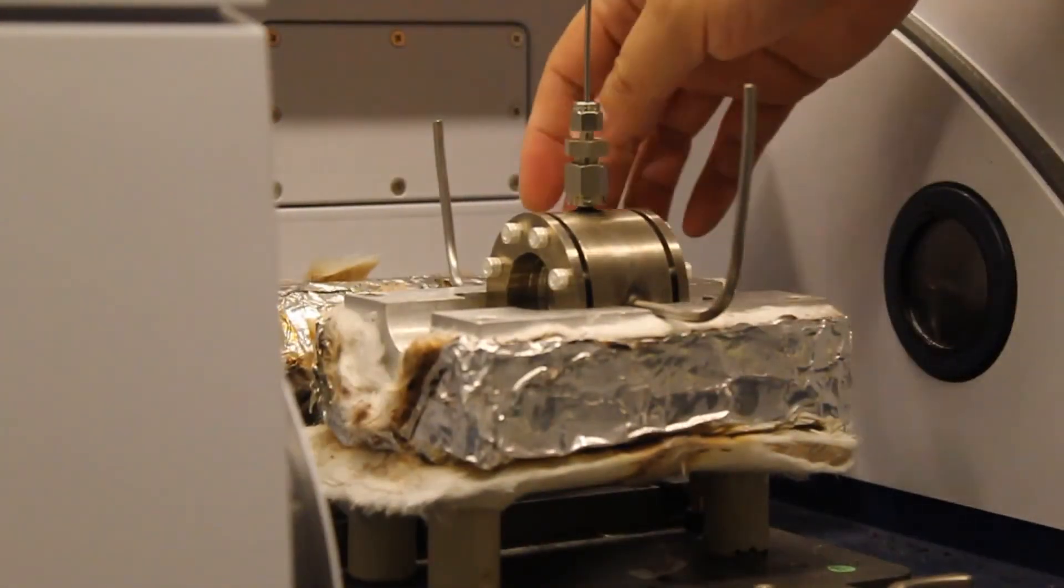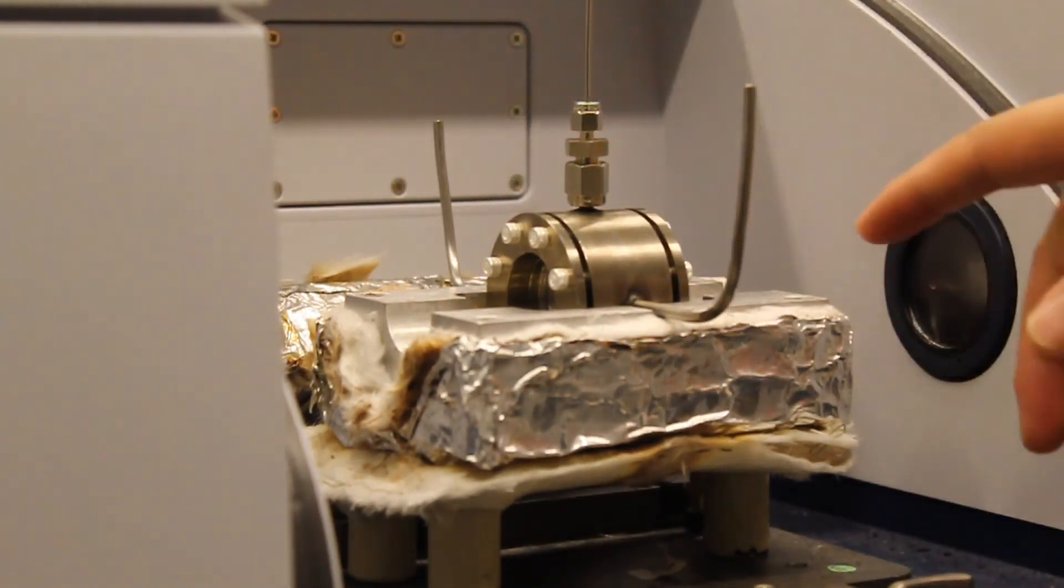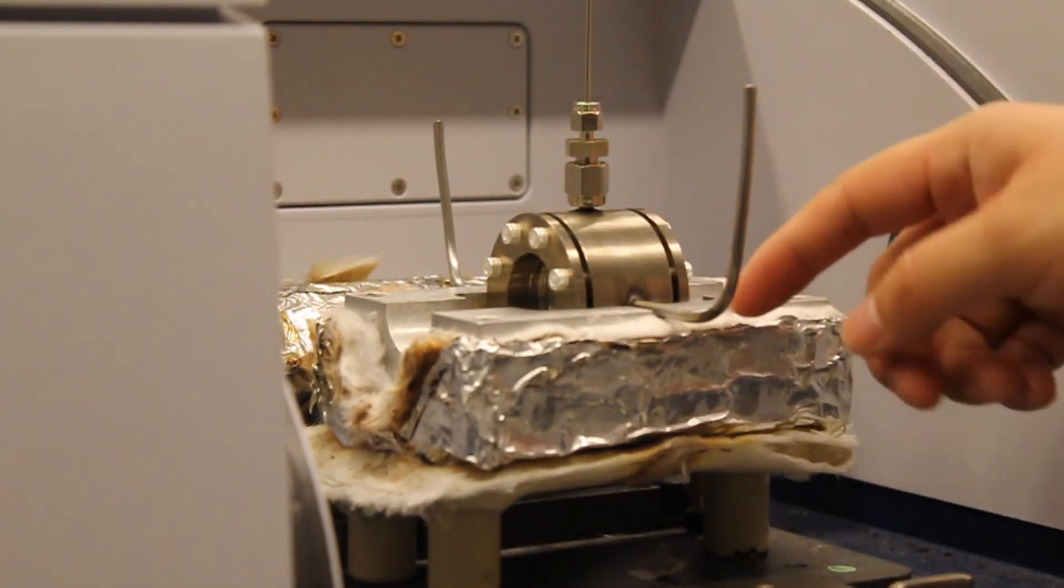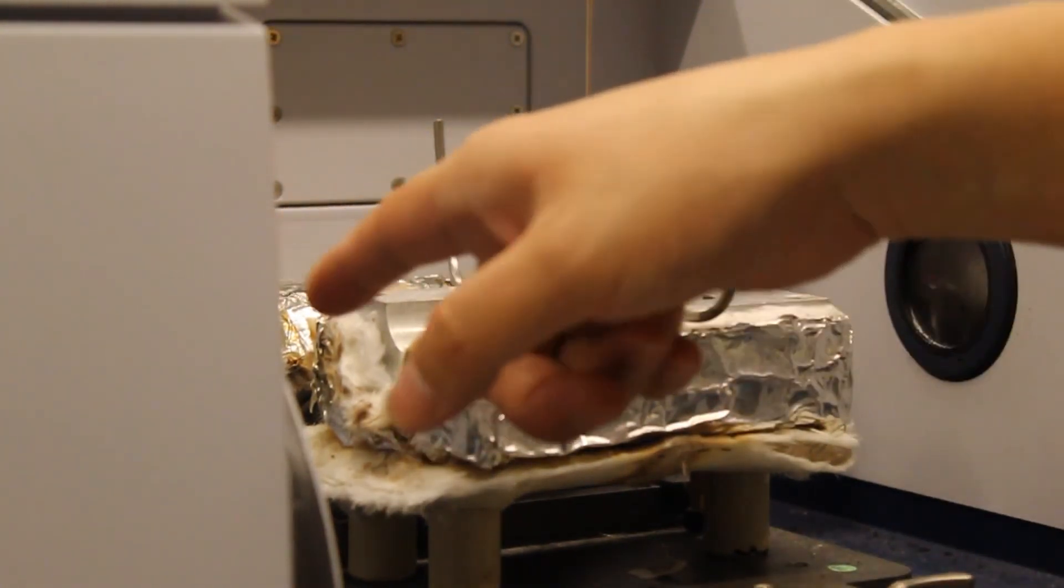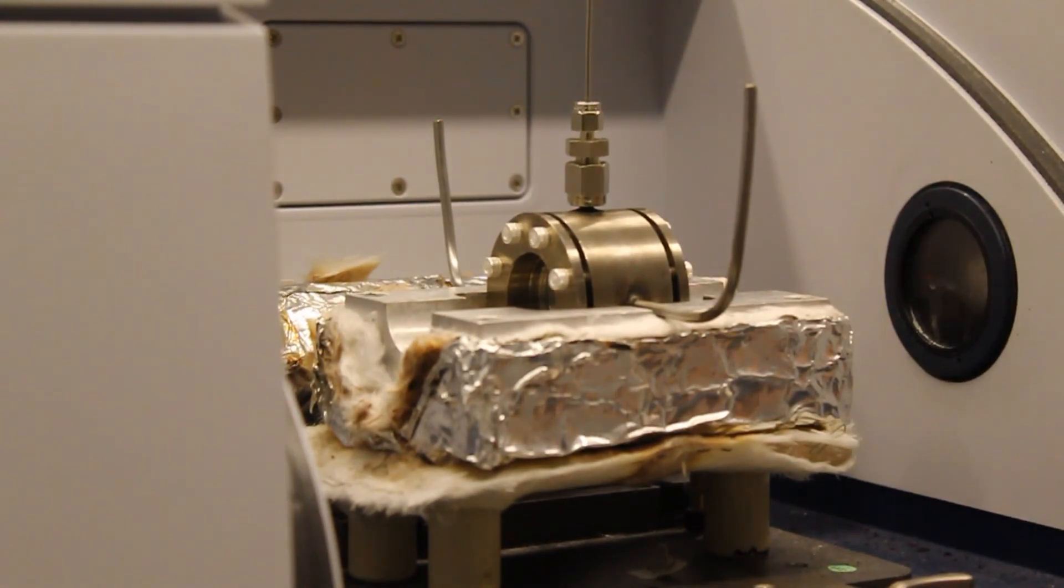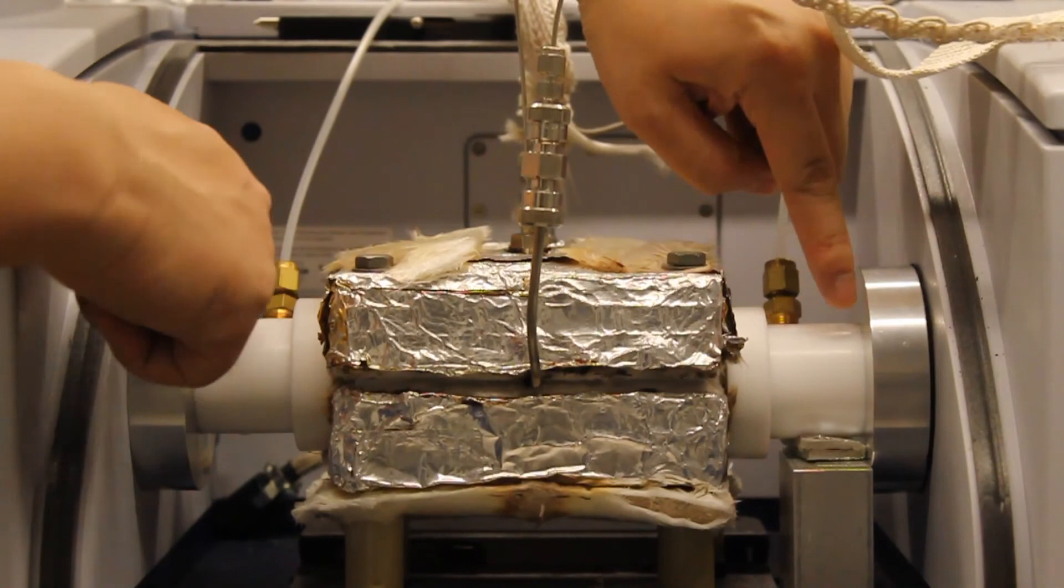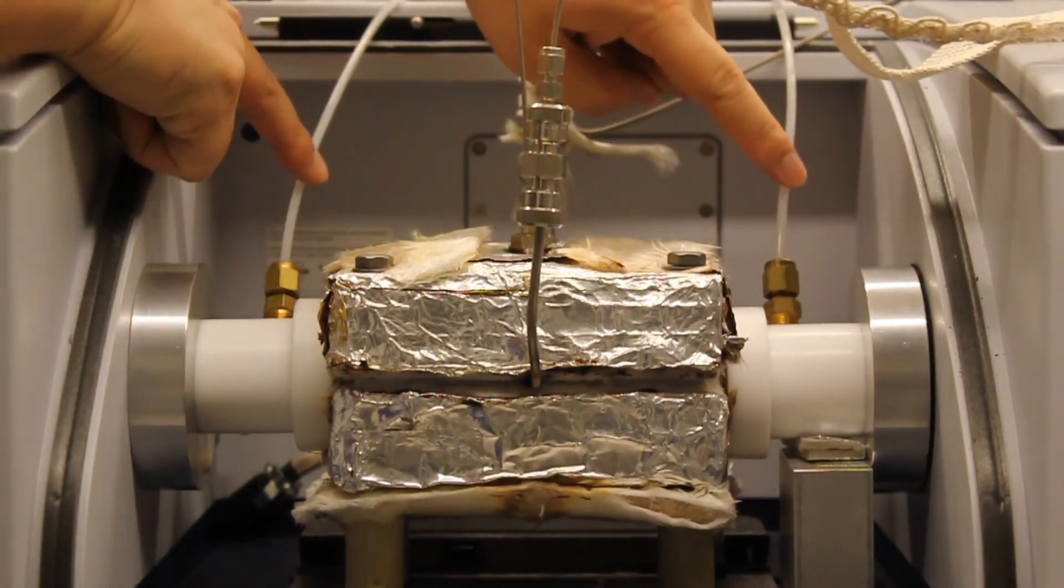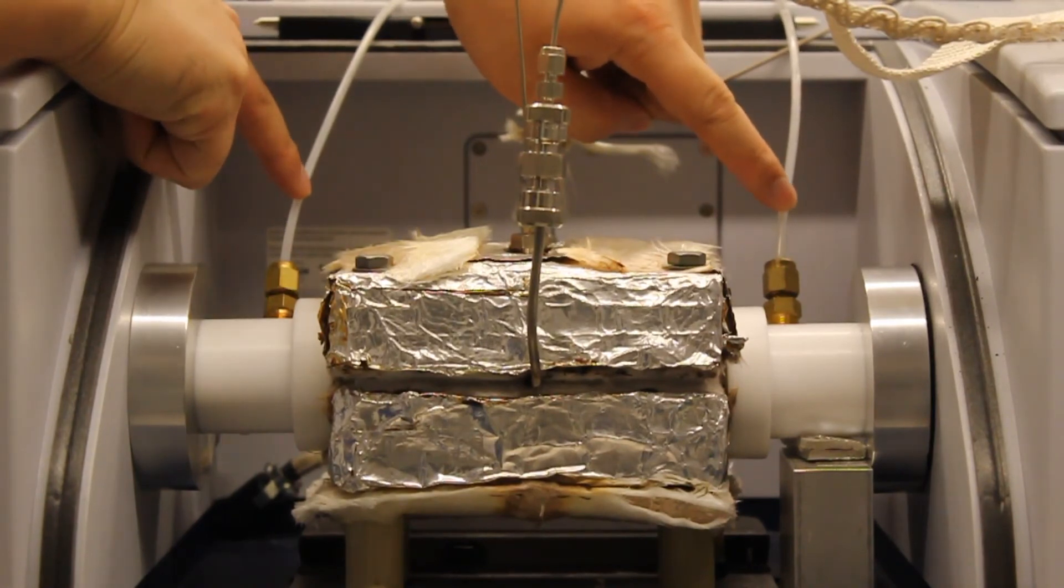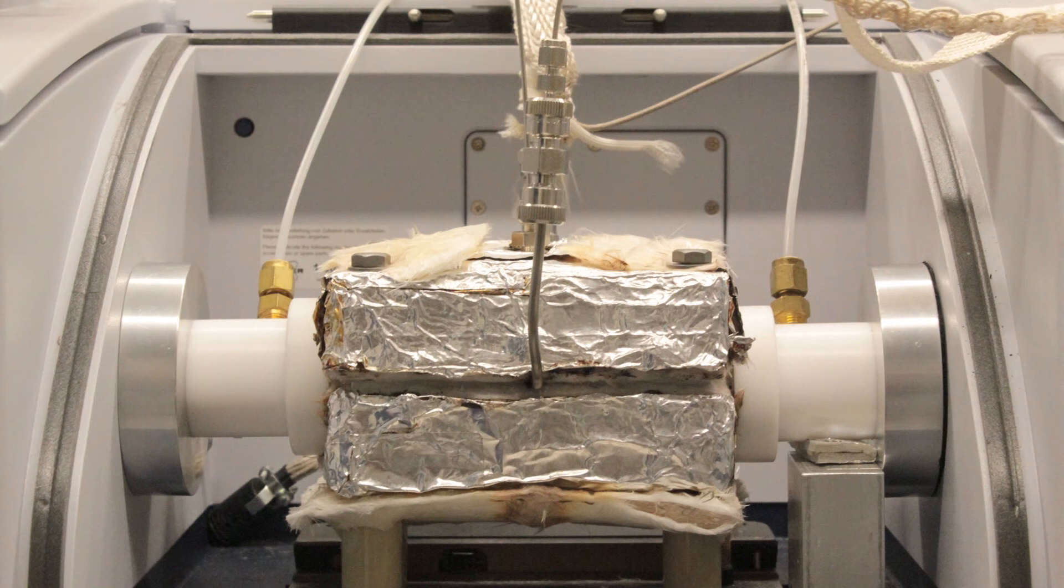After the cell is assembled, we put the cell in the heating block in the IR chamber. The IR beam travels from the right to the left. After we make the connections, we install the two beam covers. The beam covers are purged using Balston UniAir to provide an IR background free of moisture and CO2. Now that everything is installed, the equipment is ready to start experiments.